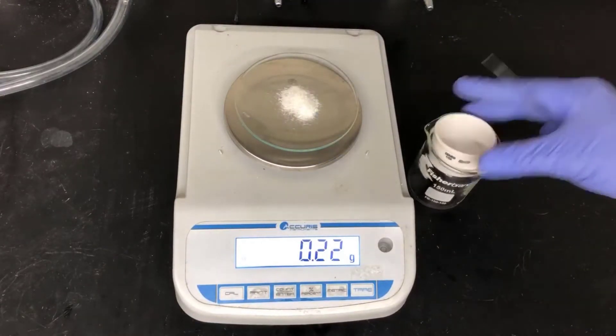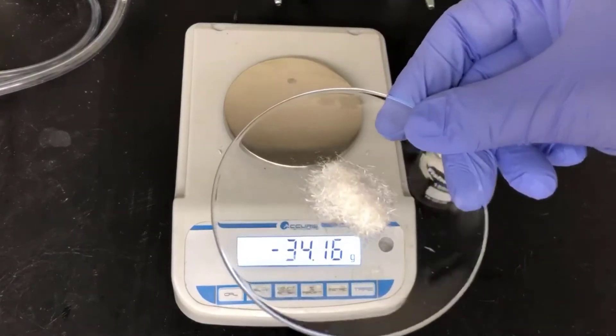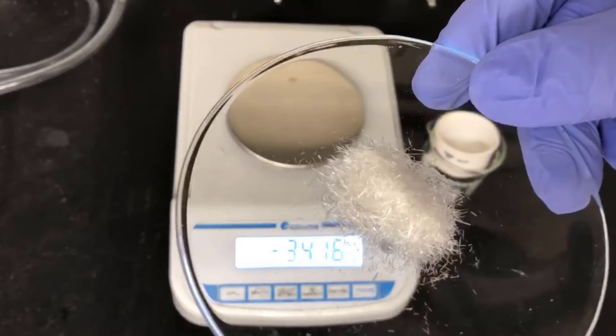I'm going to give you a close-up of the crystals here so you can see their morphology and color. I would describe these as colorless needles.